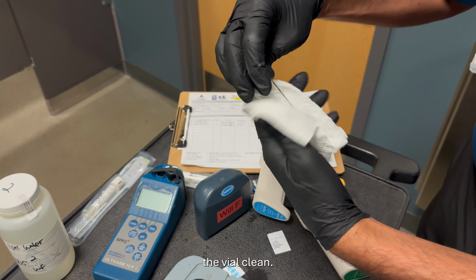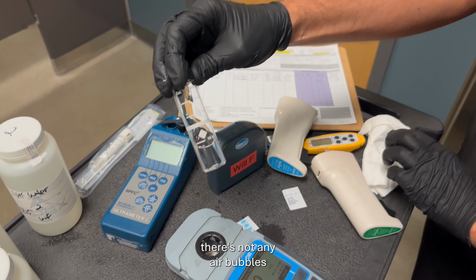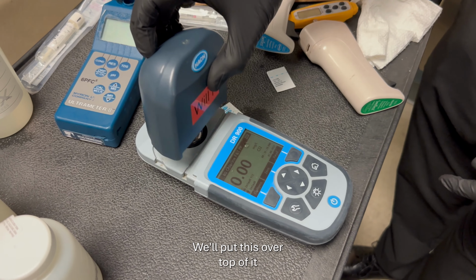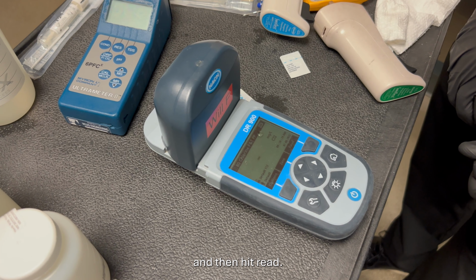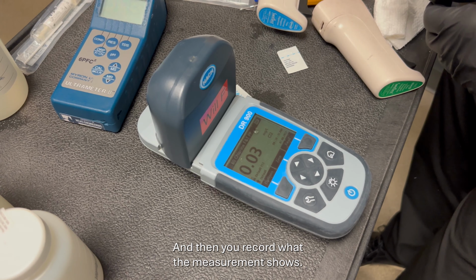Make sure you wipe the vial clean. Make sure there aren't any air bubbles that you can see, because that can disrupt the reading. You put this over top of it, hit read, and then you record what the measurement shows.